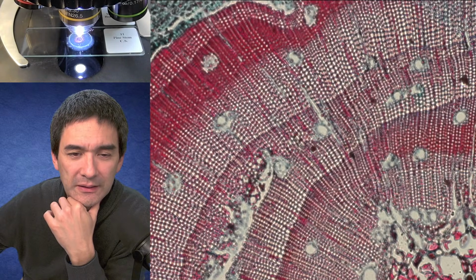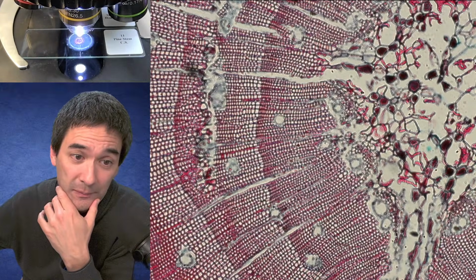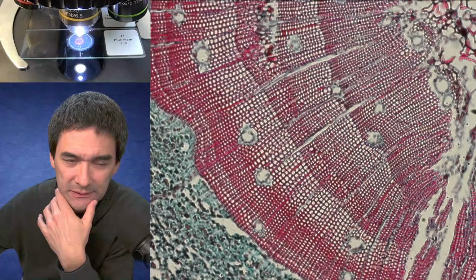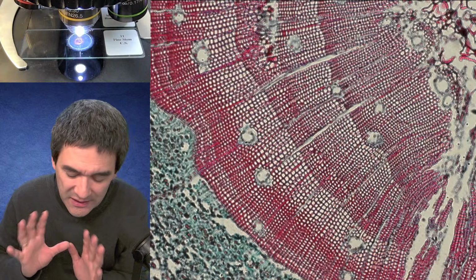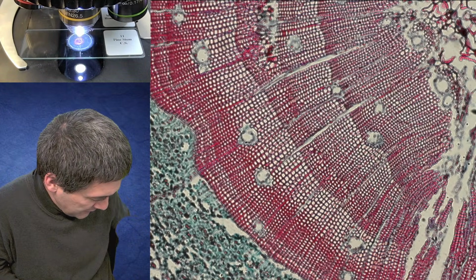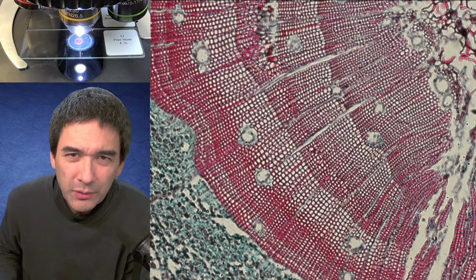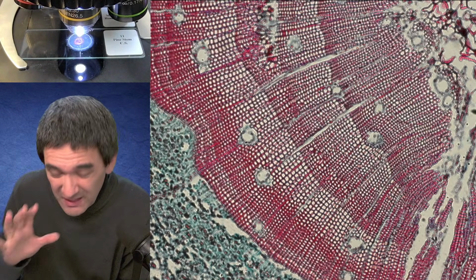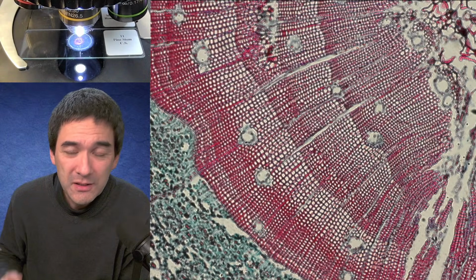But still, I mean, the 29 euros. Is it worth it? I have not made up my mind yet. I do see some possible uses of this thing, but again, especially if image quality is important, because especially kids, when they see something, it's got to be impressive. But if it's kind of blurry, and you don't see the crystal clear structures, then maybe it's not quite as captivating.